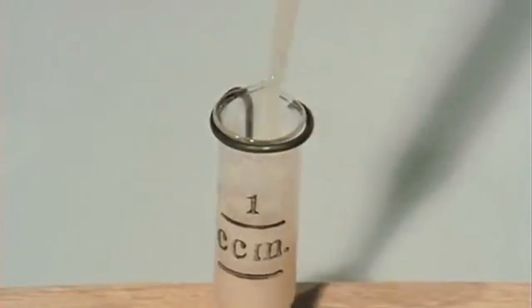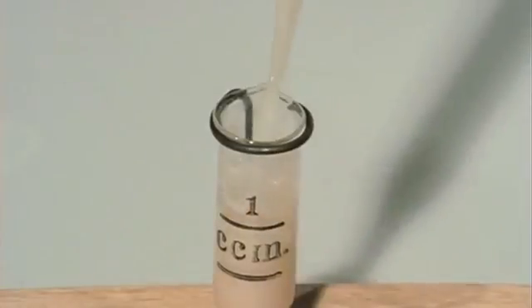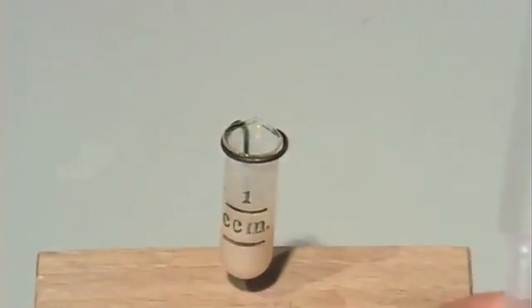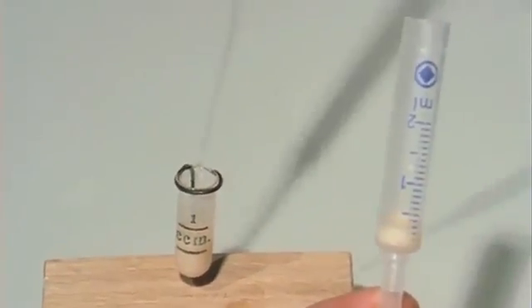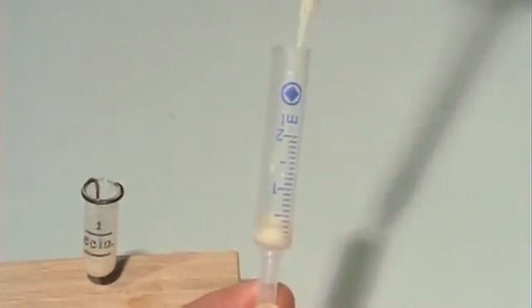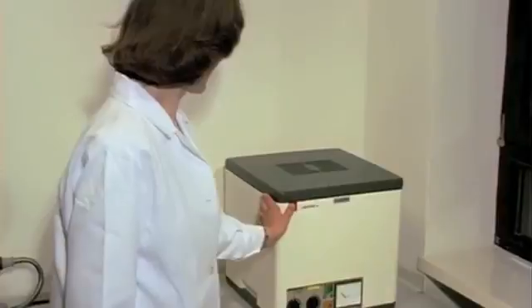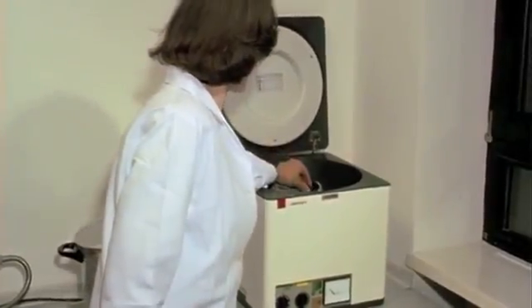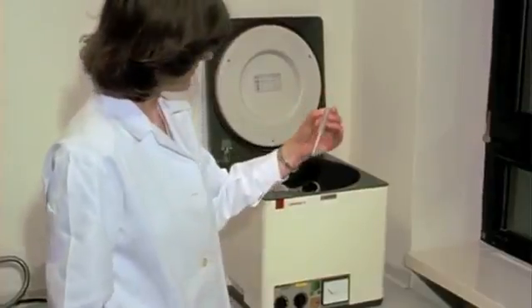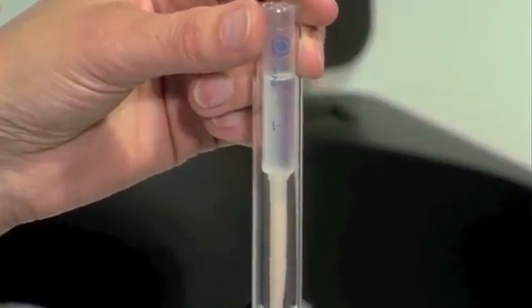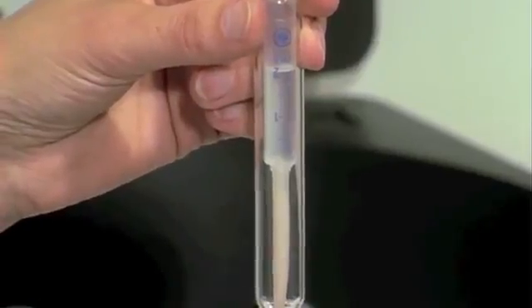A pipette is used to mix the suspension thoroughly and fill it into a special centrifuging tube. Any rotary centrifuge is suitable for centrifugation. After a 10 to 15 minute run at 1000 g, the sperm are deposited at the lower end of the tube.